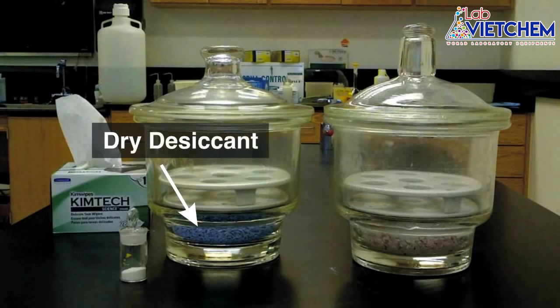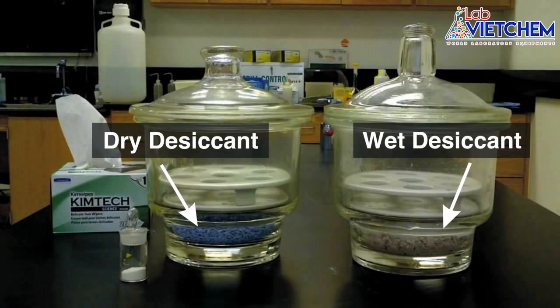Notice the color of the desiccant. It's going to tell you if it's dry and usable, or if it's wet and needs to be swapped out for some new product.